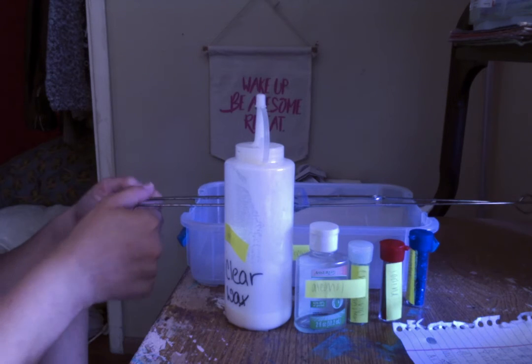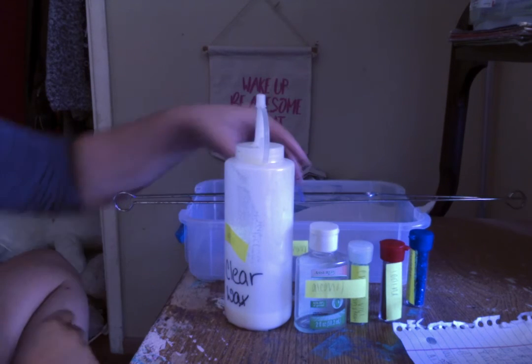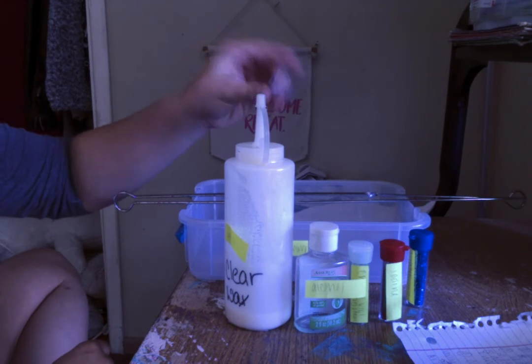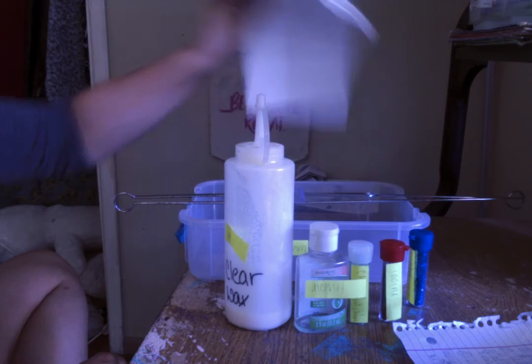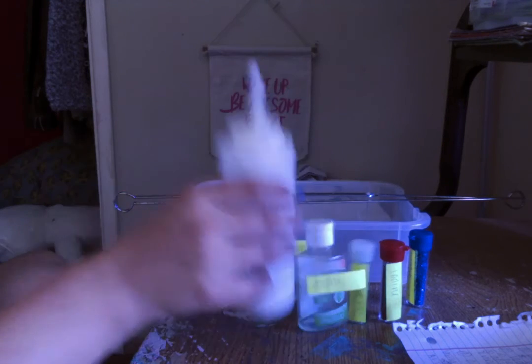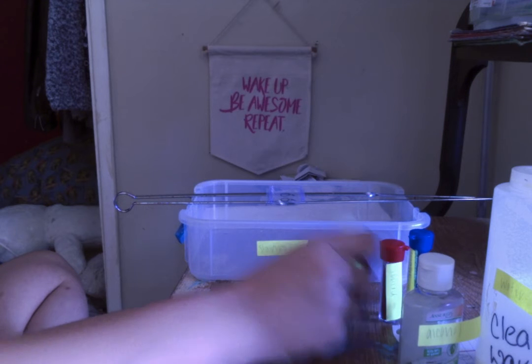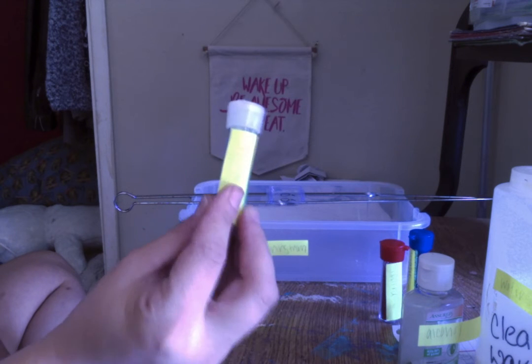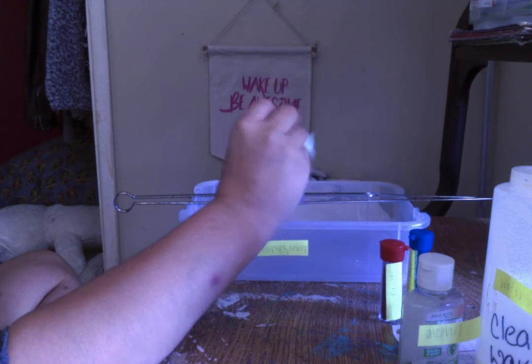We've got our rods, our staining tray, and then of course the heat fixed bacteria slide or smear slide. And then we have our napkin to dry it off when we're done. So first we're going to want to grab the primary, the crystal violet. This is going to turn all cells on the slide purple, gram-positive or gram-negative.